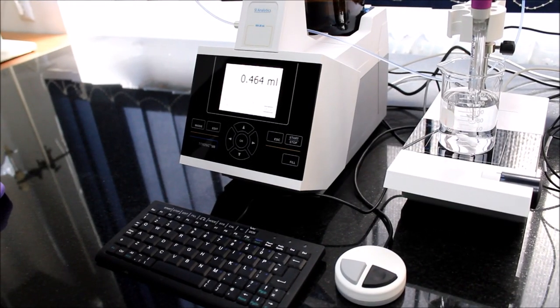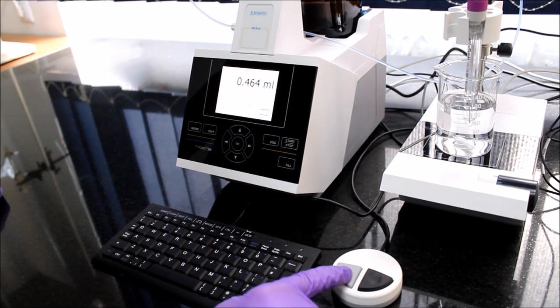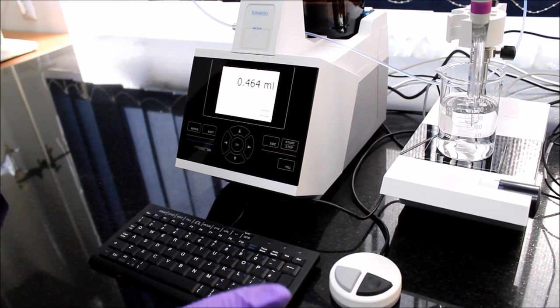To stop the titration process, press the left button for two seconds and the machine will beep shortly, meaning the titration is finished.